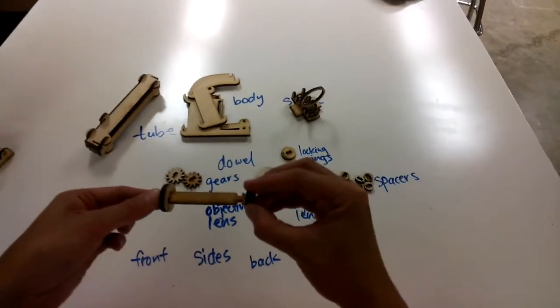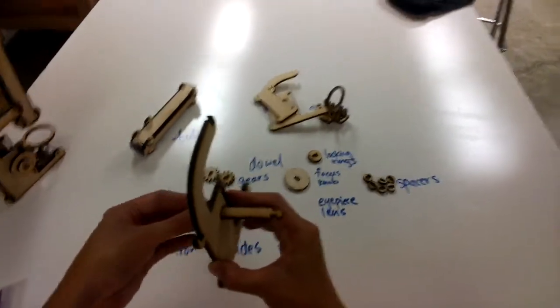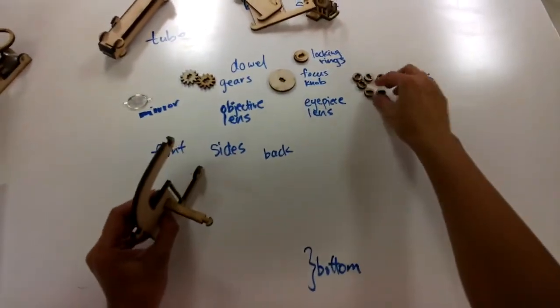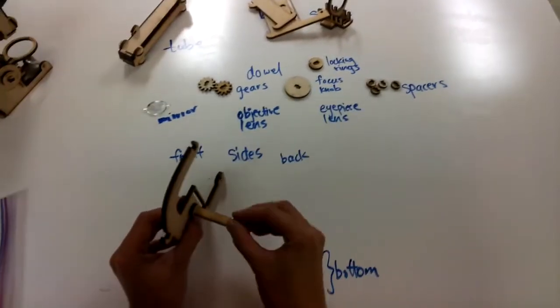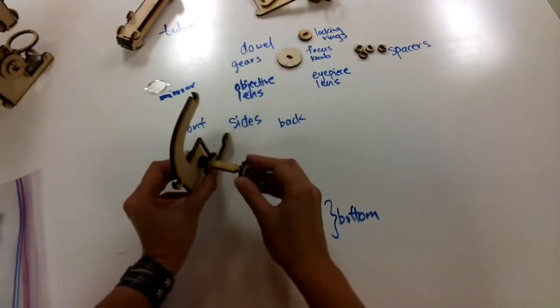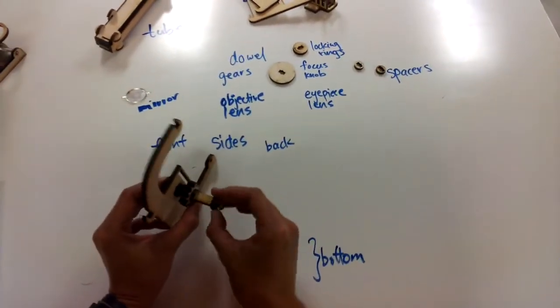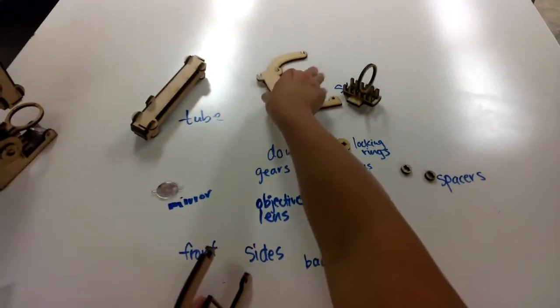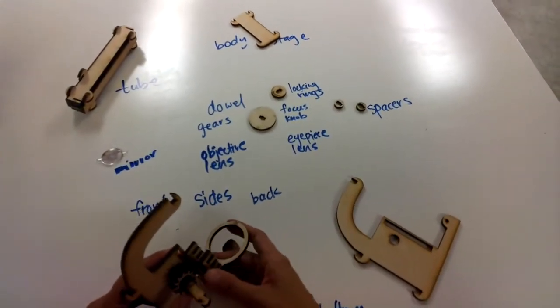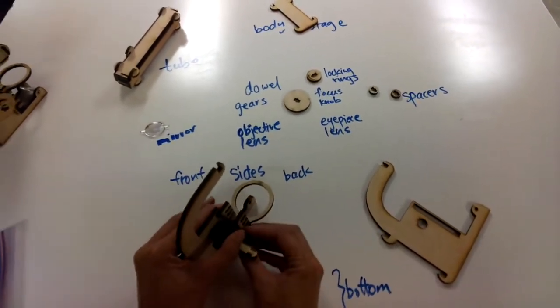Now you're going to put one spacer, and then you're going to grab one of the bodies and slot it into the hole in the middle. Okay. Then we're going to continue adding to this little skewer here. So add two spacers, and then add the two gears, two more spacers. And then this is where we would add on the other side of the body, but before we do that, we want to put the stage on, because otherwise it becomes really difficult to add the stage later. So you kind of have to have many fingers holding everything to keep everything together.